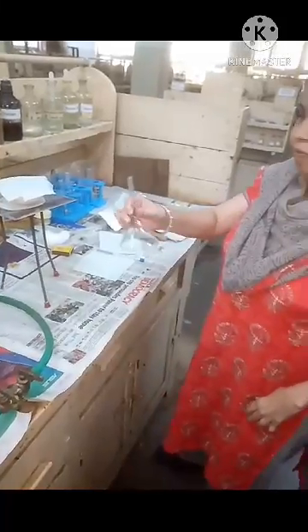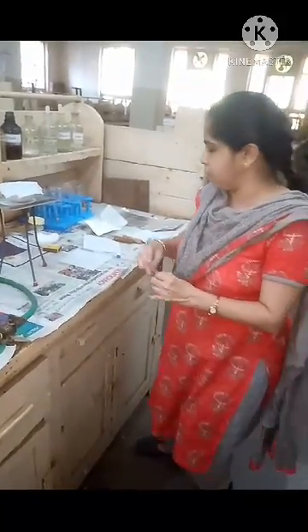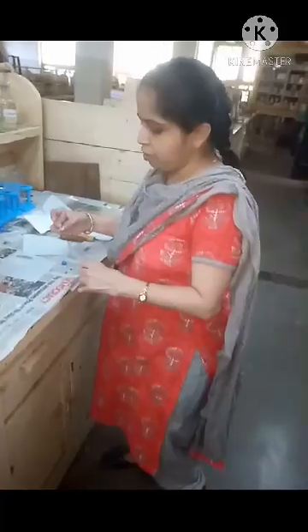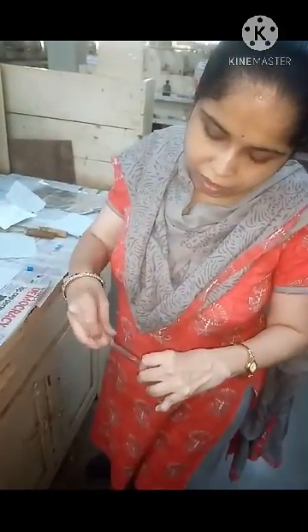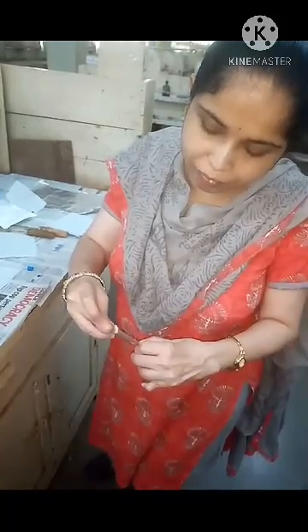Now we have to place the glass funnel on the porcelain dish which is covered with filter paper. Before placing the glass funnel, we have to seal the stem of the glass funnel with a piece of cotton gently. Take a piece of cotton and insert it gently into the stem of the glass funnel so that the stem is sealed. The glass funnel should be clean and dry also.